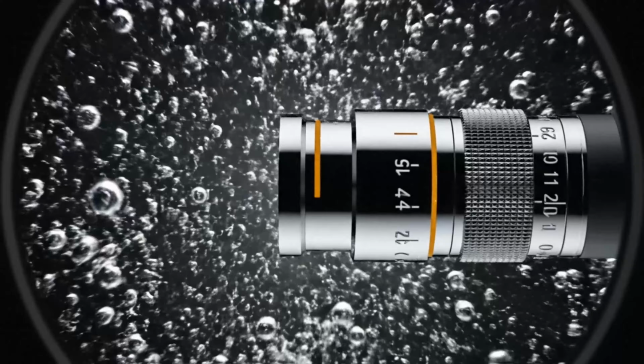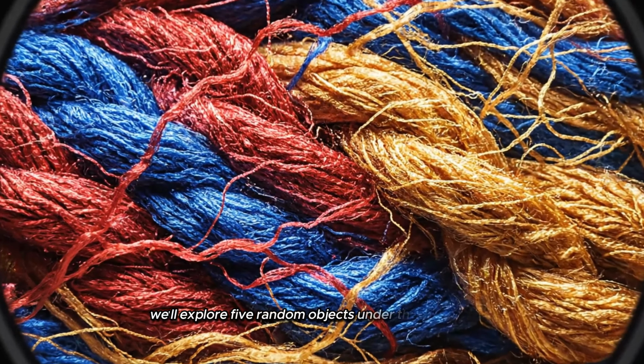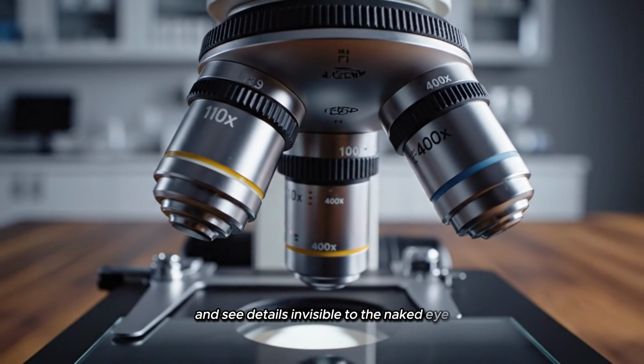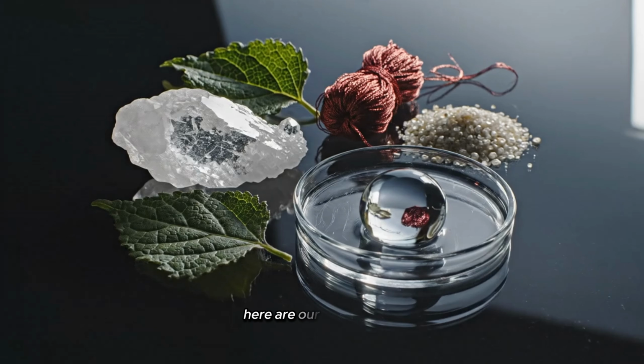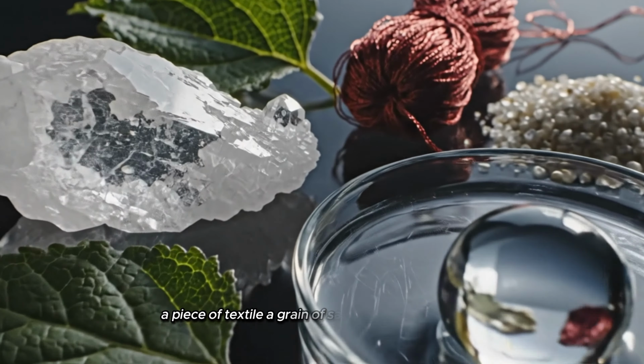Today, we're diving into a hidden world right under our noses. We'll explore 5 random objects under the microscope and see details invisible to the naked eye. Here are our 5 subjects: a salt crystal, a fresh leaf, a piece of textile, a grain of sand, and a drop of water. Each one hides its own miniature universe.